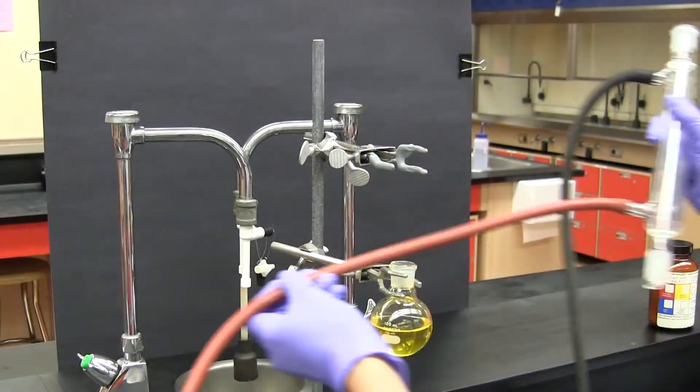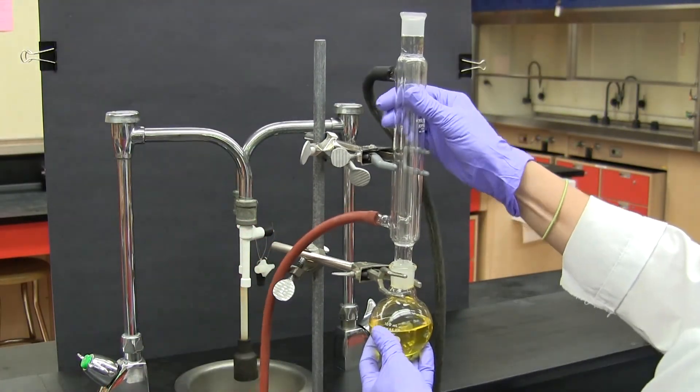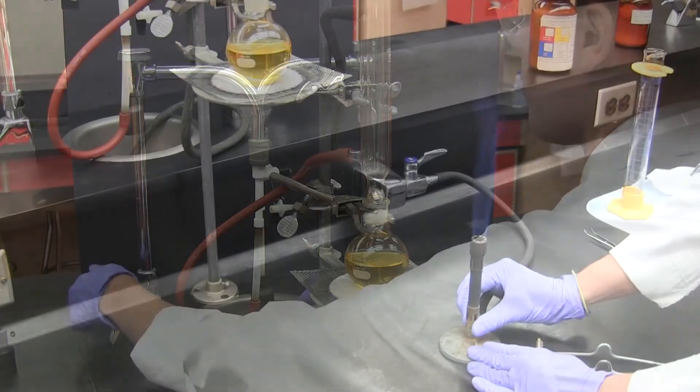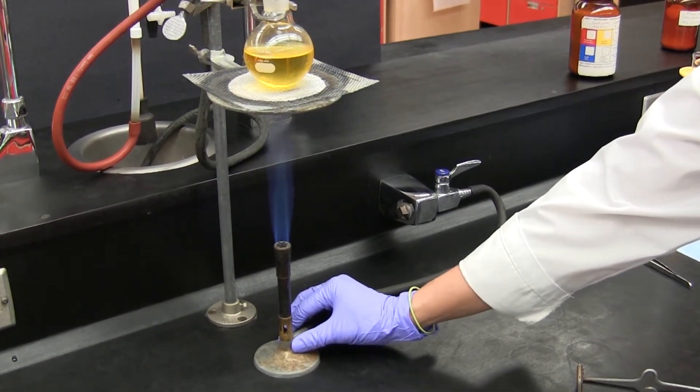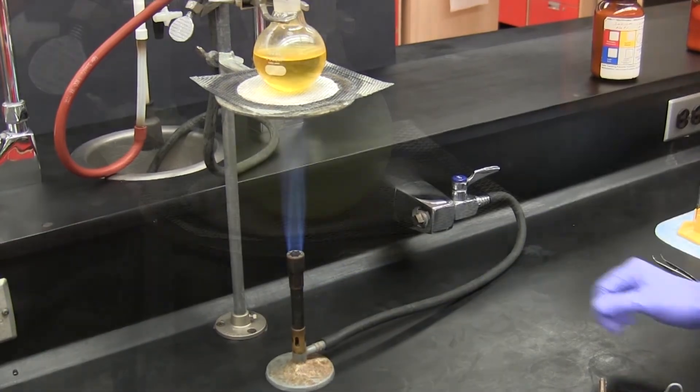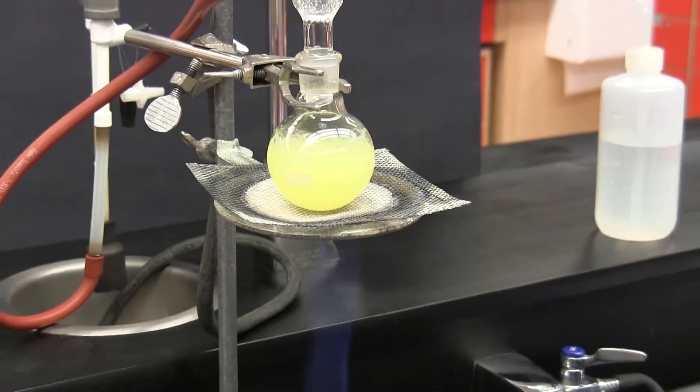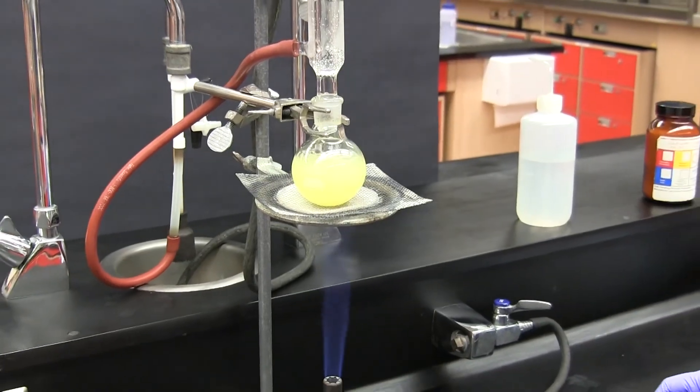So this completes the basic practical information on how to set up and perform a reflux. Pay close attention to the script in your lab manual and any directions given by your instructor since there could easily be variations to the procedure dependent on which experiment you're doing.